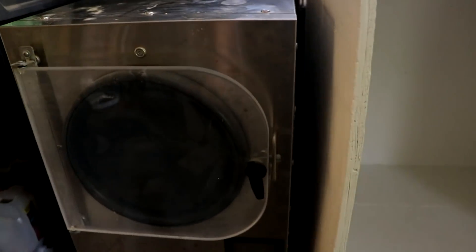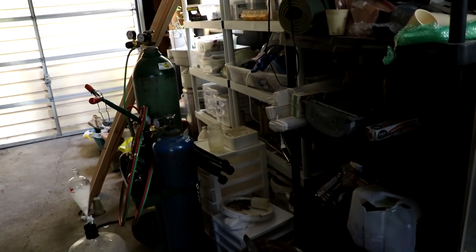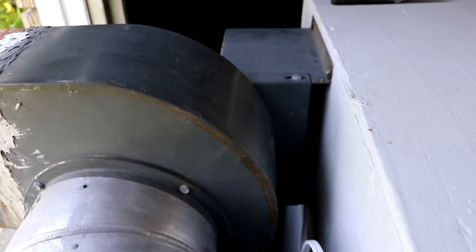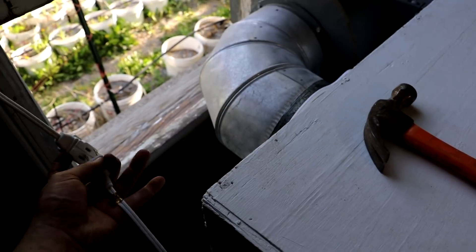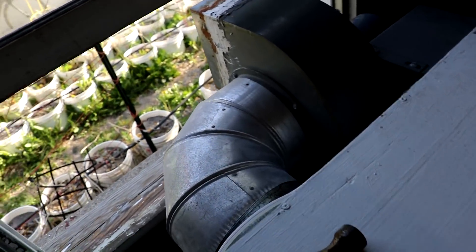You can see the vacuum chamber is now over here, and I'm going to cut a hole right in the back and put in the fan. I'll plumb in some electricity somehow. I've got it bolted in, the hole's cut, and everything's plumbed — let's see what happens when I plug it in. Yeah, I don't even know if this bolt works still... sure does! Nice. Look at that — I might not even need a door on it; that pulls a lot of air.